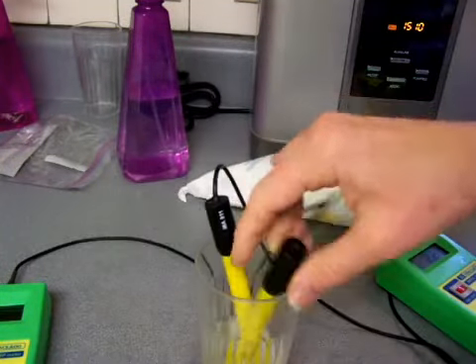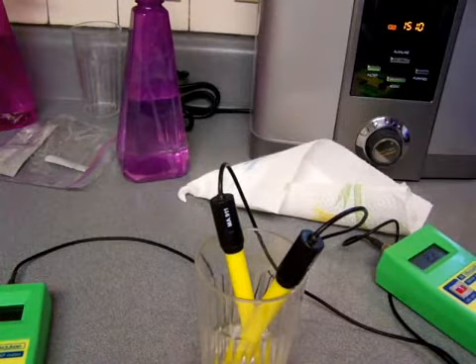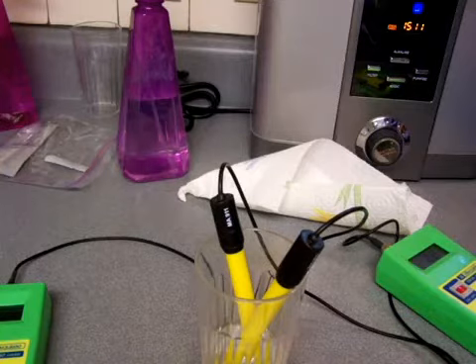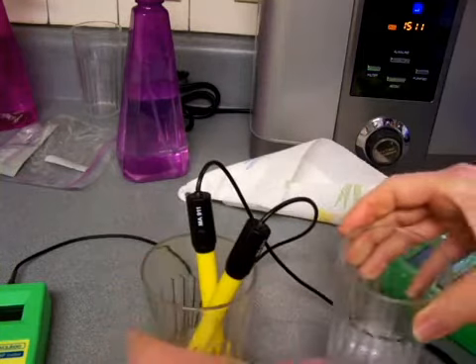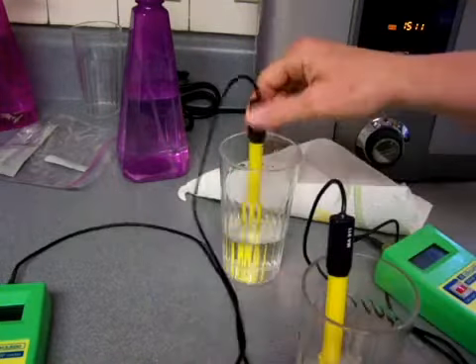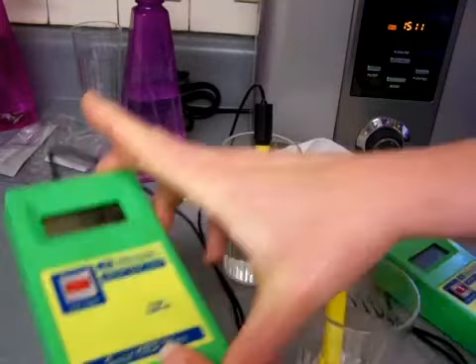Now I'll stick it back in the acidic water for now, and then I'll get some more ionized water to test it. And if it comes up closer to the negative 700-ish, which it should be, then once it gets up to around negative 700 or a little better than that, I will be satisfied, because that's what I'm used to and that's what I know the Athena will give me. All right, so I'm going to stick it in there and see what it's giving me.